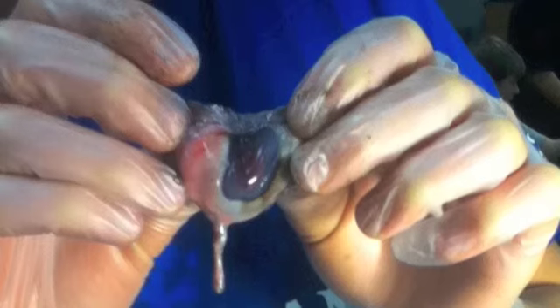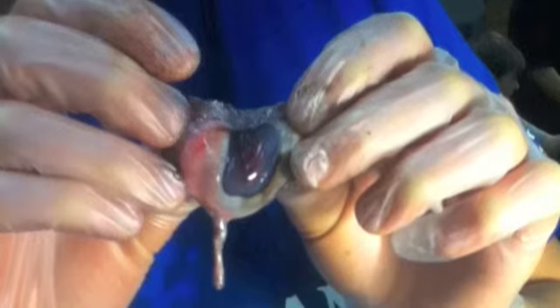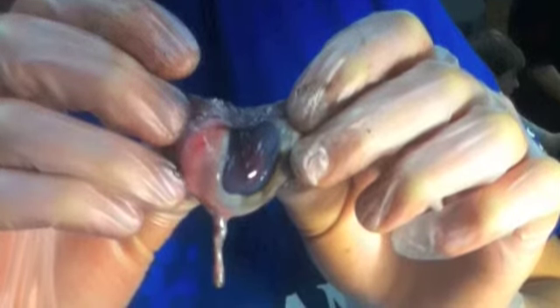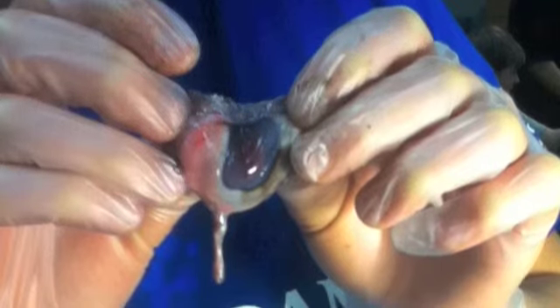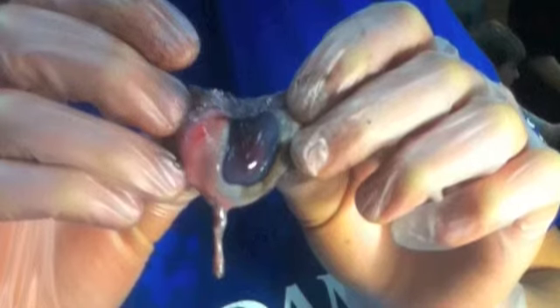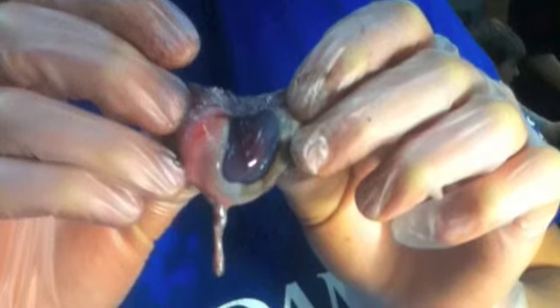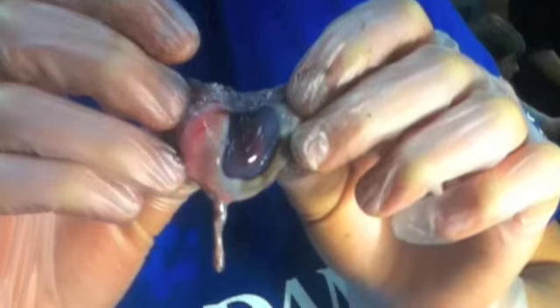The fovea's location is on the retina. If we go back to the cornea, we can focus on the iris and the pupil. The iris is formed from the choroid layer that gives the colored portion of the eye, and it can regulate the amount of light entering the eye. The pupil is the hole in the center of the iris through which light passes to the retina. When it's bright the pupil narrows, and when it's dark the pupil widens.